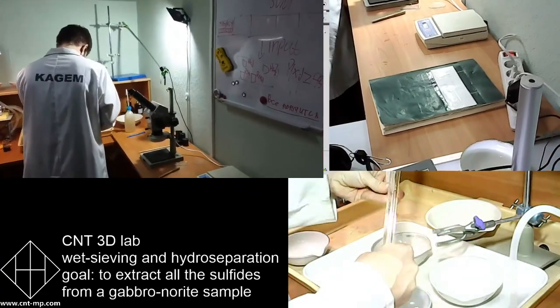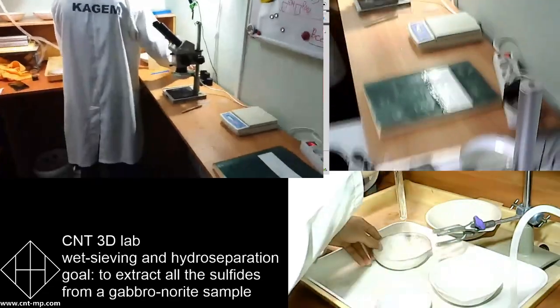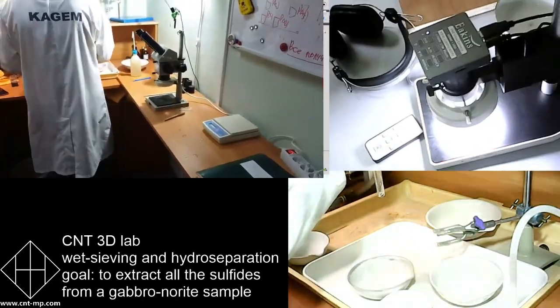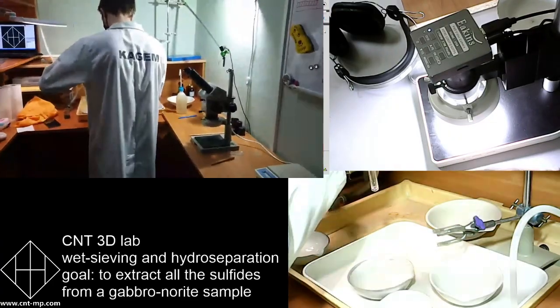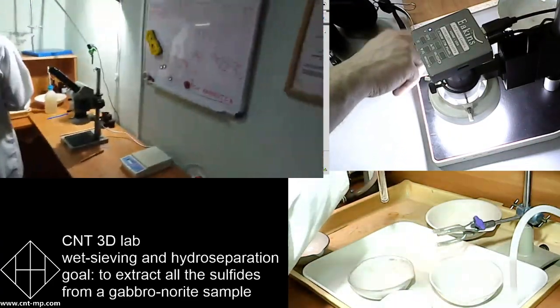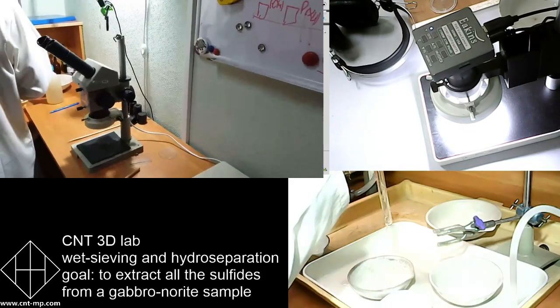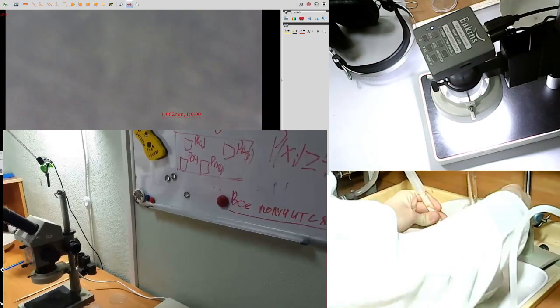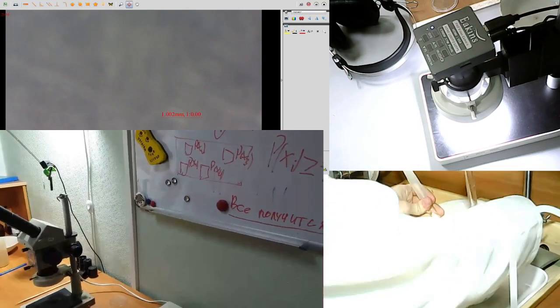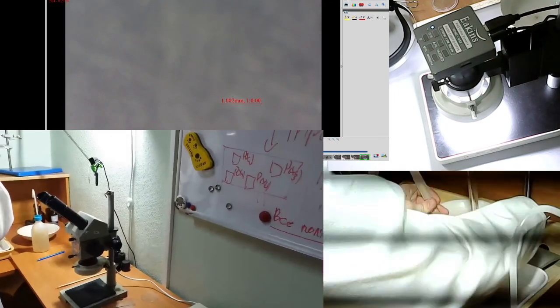Eva is asking, can HS be applied to soil samples as well? Definitely, if you get rid of organics. So usually the soils get burned, specifically, I would say, producing the ash from organics. And then through the set of sieves, and then yet again through hydroseparation. Definitely, yes, the soil has been used widely.